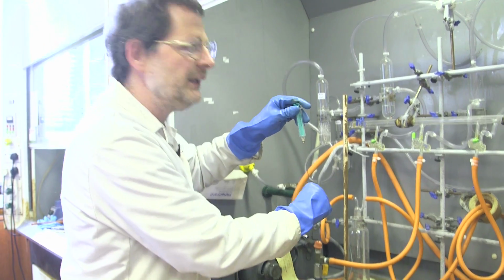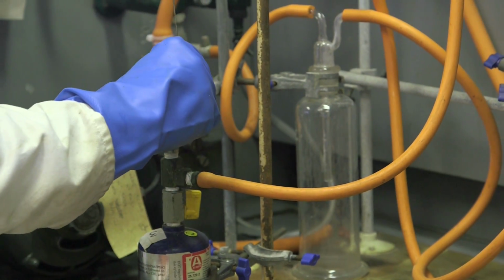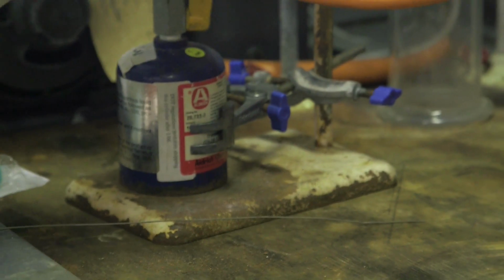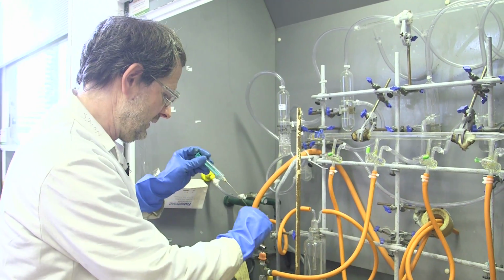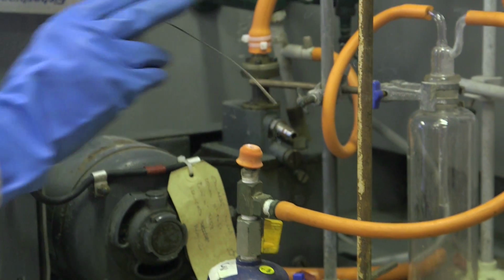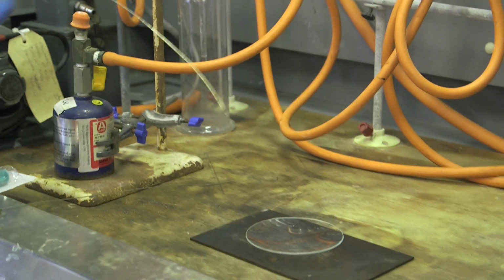So I've flushed the syringe three times with argon, and now that should mean that we can pick up some trimethylaluminium with comparative safety. So we go down into this canister, and I'm just going to take a little bit, and then I'm going to pull this up like so. Now there may be a slight flame as this comes out the end. There it is. Right. So why can't you weigh out trimethylaluminium in air?